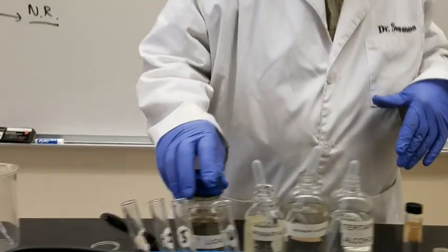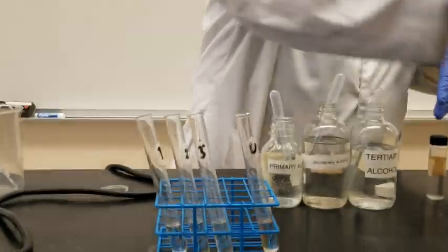Okay, so what we're going to do now is the following. We're going to be using the primary alcohol.